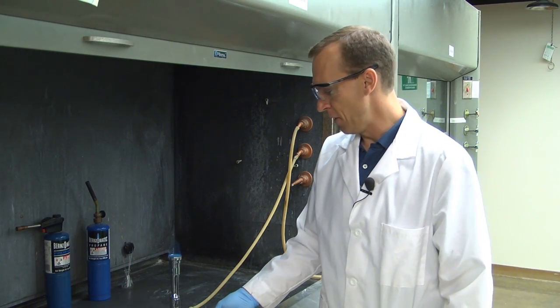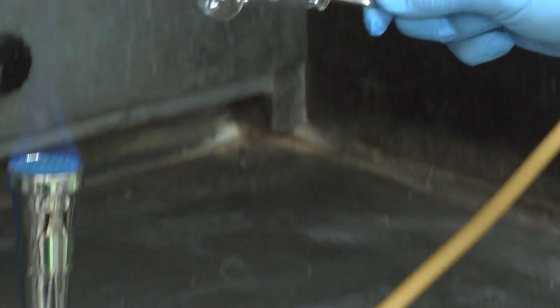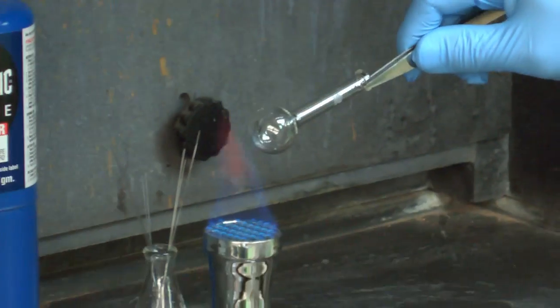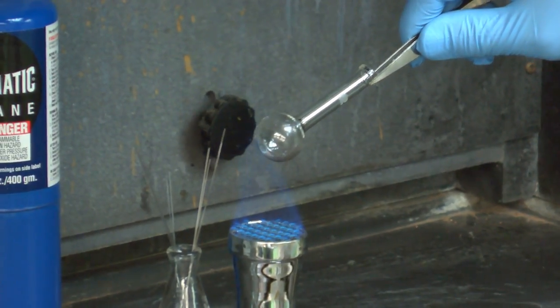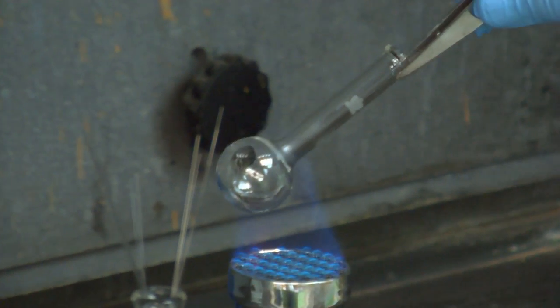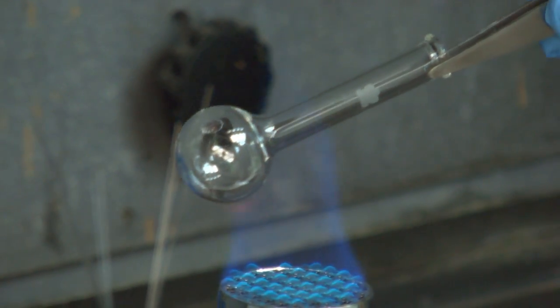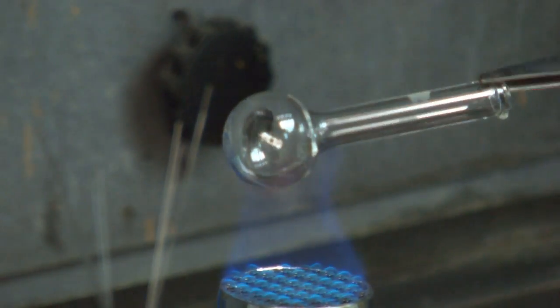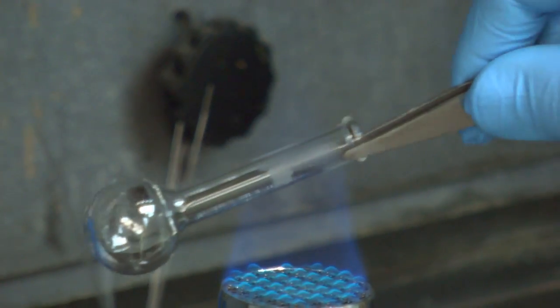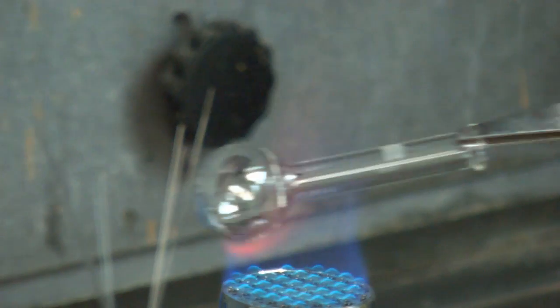So with flaming the glassware, just going to use a pair of forceps to hold it, and then you just begin at the back side. And as you heat it, you can see the condensation rising up the glassware. And I'm just going to persuade it up the neck of the flask. Once again, you want to make sure that there's no flammables in the area whenever you work with an open flame.